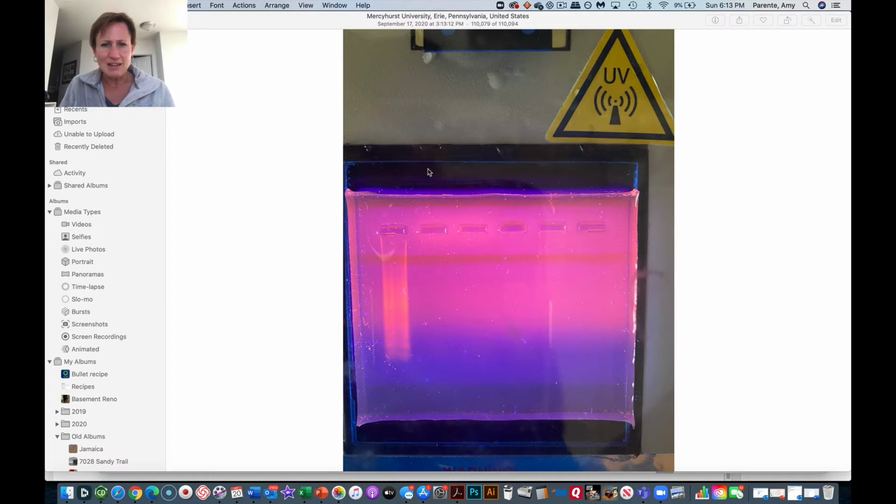But right now I've got lots of other extraneous things here, and I'd like to do my best to have this gel do a better job of representing what I want the reader to see. So I'm going to use Adobe Photoshop to do that. So I'm going to open Adobe Photoshop here.